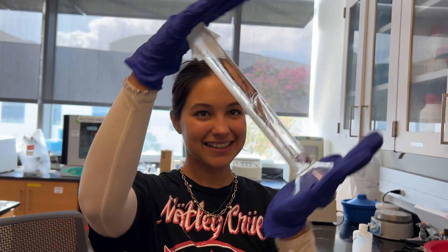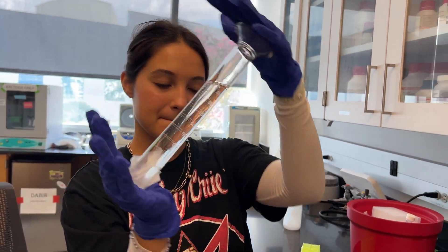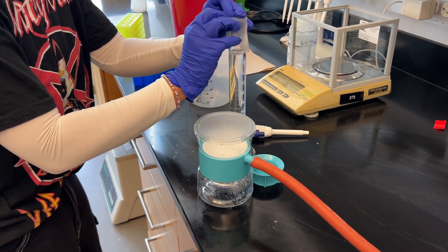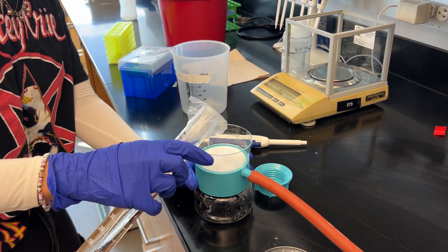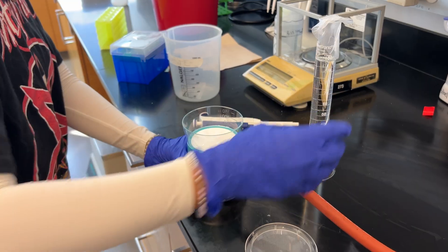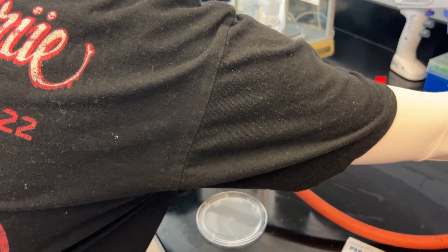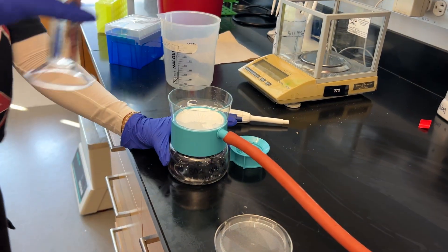Because it is 80% glycerol and not 100%, we can actually go ahead and vacuum filter it just like normal and it won't be too bad. Let's set up the vacuum filter. Wet the filter a little before you use it — it's not good to have the vacuum on when it's totally dry. Turn the vacuum on and look to see that stuff is coming through and that you don't hear loud noises indicating the seal isn't on there.